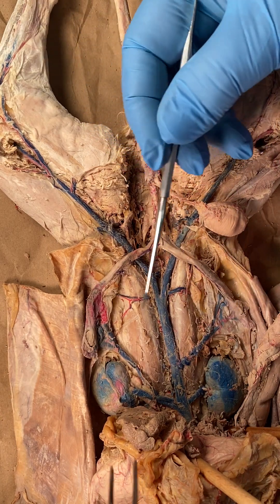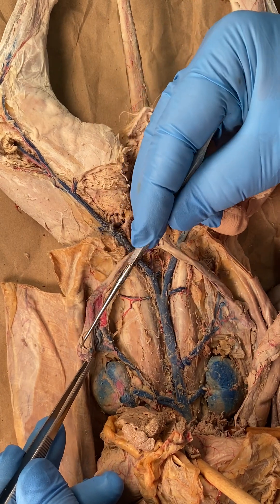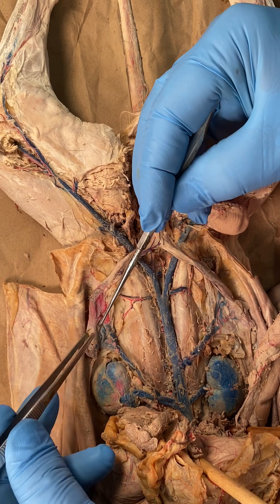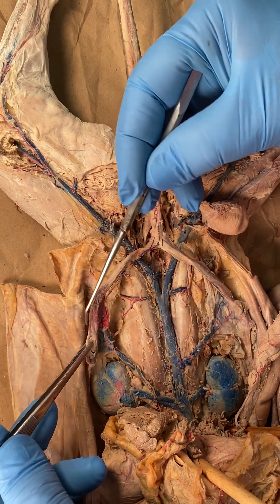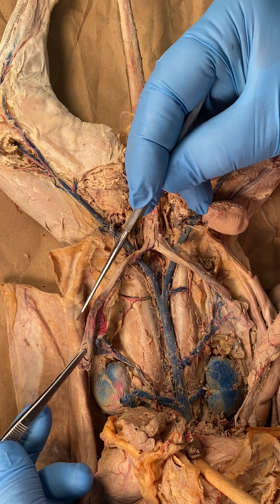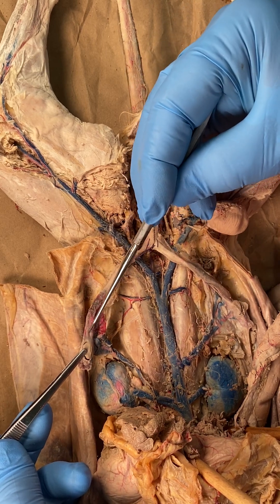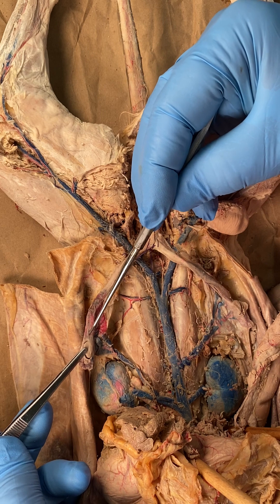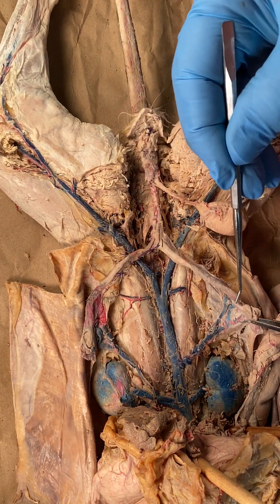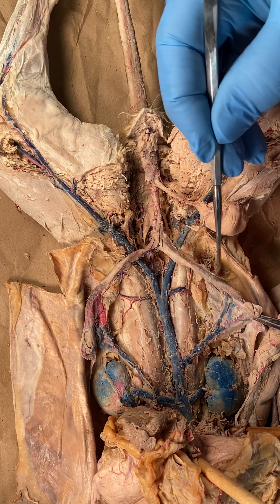The next thing is the tiny little structures. I don't tend to ask them on the practicals, but other professors might. There's the fimbriae — cats do have the fimbriae, like the female human does. And you can barely see it on this side. That little tiny tube going to the uterine horn is the fallopian tube, or uterine tube as some people like to call it. On this side, there's the ovary and the fallopian tube on the right side, and that's what leads to the uterine horns.